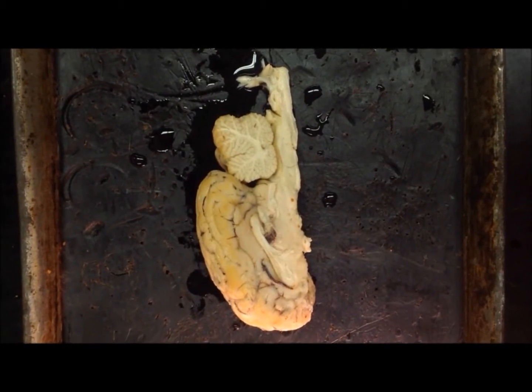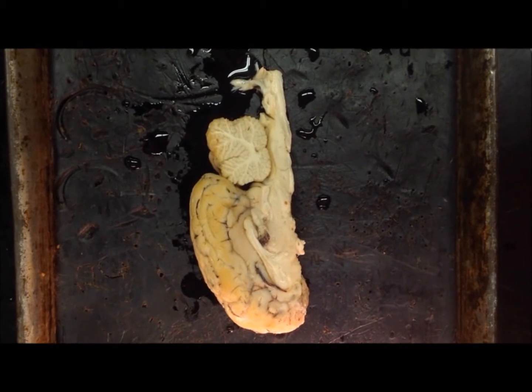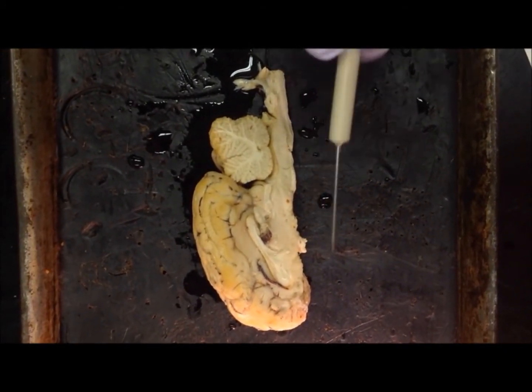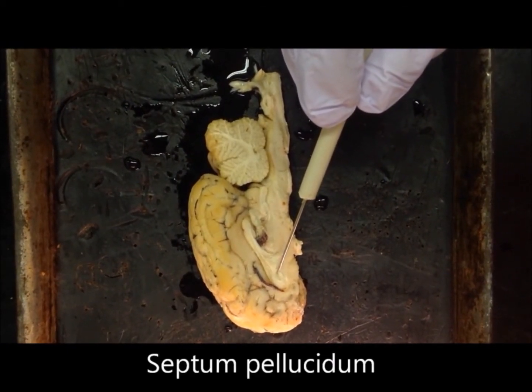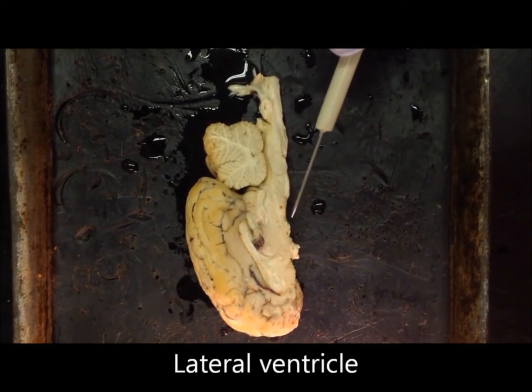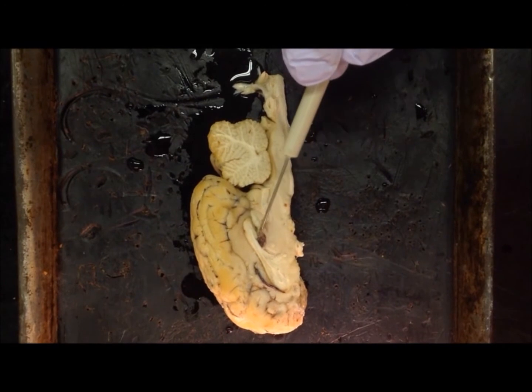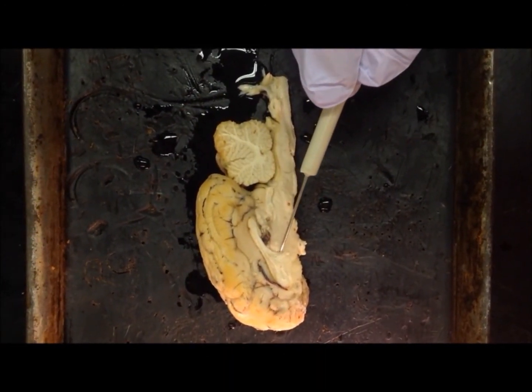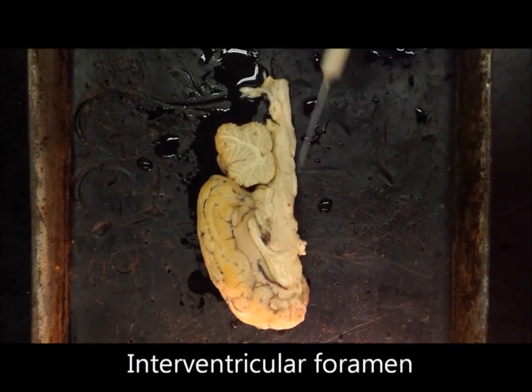We will now take a look at the ventricles. They are the spaces through which the cerebrospinal fluid, or CSF, travels. The membrane within the corpus callosum is the septum pellucidum. Behind it lies the lateral ventricle. Locate the thalamus and go dorsal to that to find the third ventricle. Trace it towards the anterior to find the interventricular foramen.